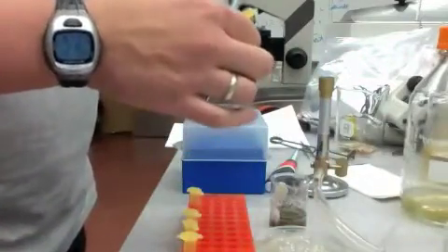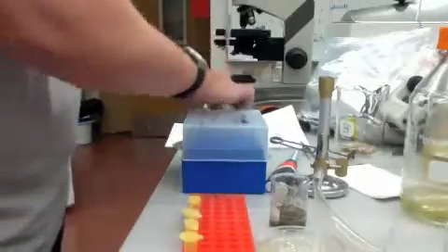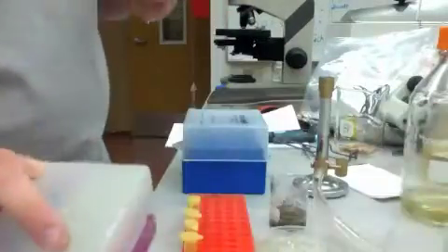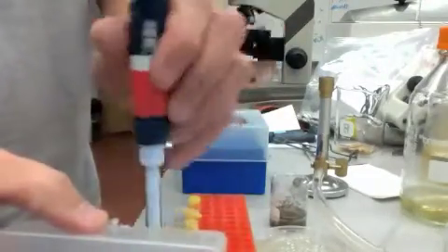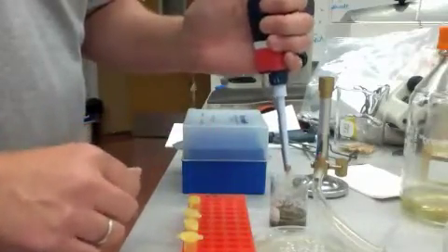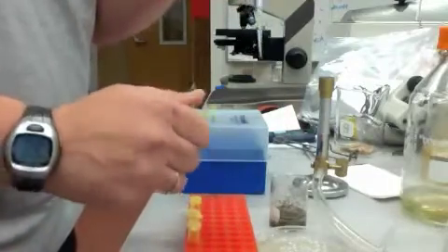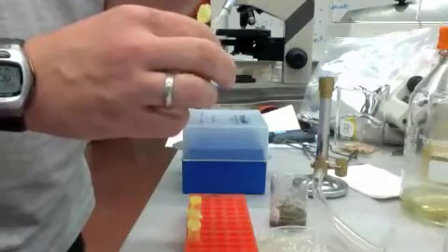Now that you've got all these ready, you then take your sample and a pipette tip that fits. And you make your first dilution, a 1 to 10 dilution. So you go into your sample, go into your first diluent, put the sample in.